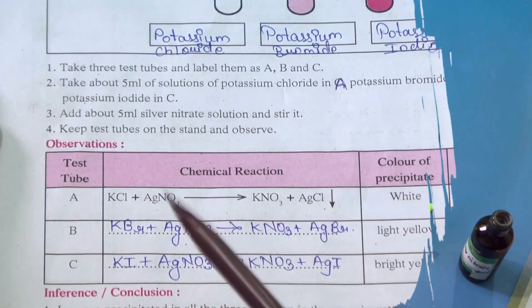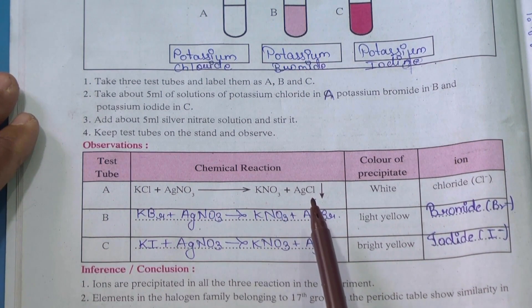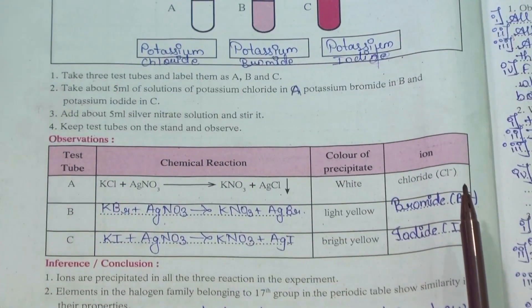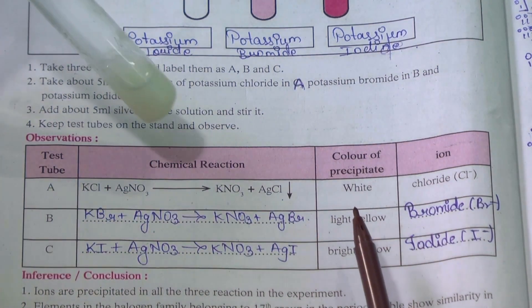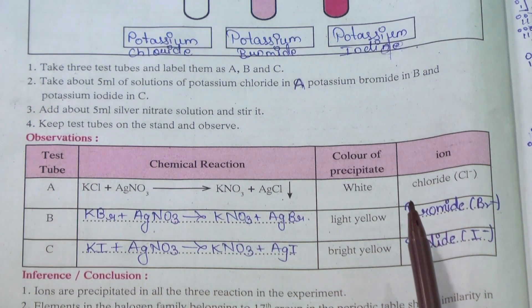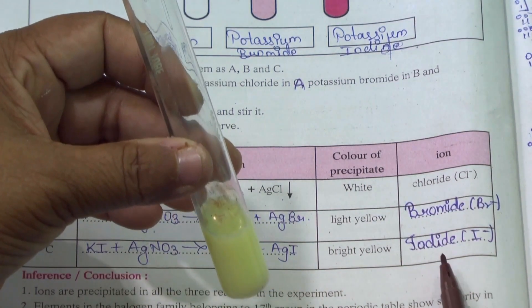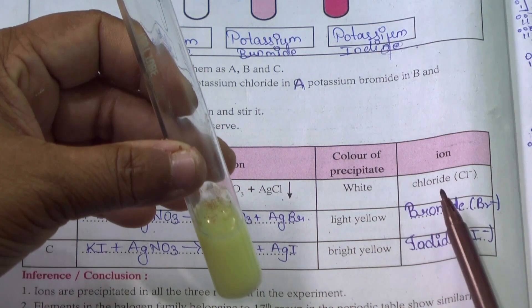Now we will be noting down the observation table. In test tube A: KCl plus AgNO3 gave KNO3 plus AgCl, which is white PPT — chloride ion test confirmed. In the second: KBr plus AgNO3 gave KNO3 plus AgBr, which is light yellow PPT — bromide radical detected. When potassium iodide and AgNO3 were mixed, we got KNO3 and AgI, which is a bright yellow PPT — iodide radical ion found.